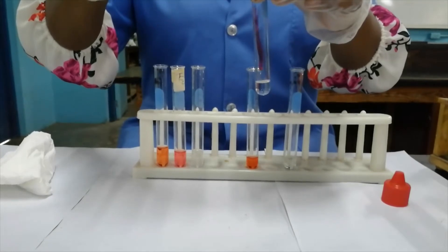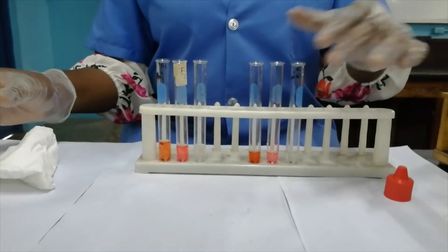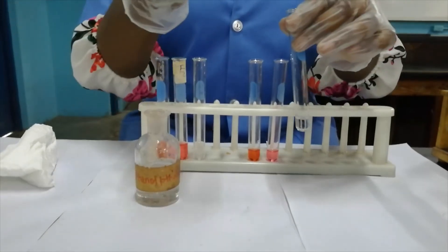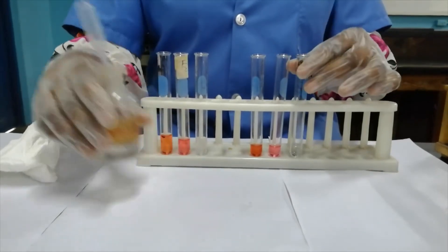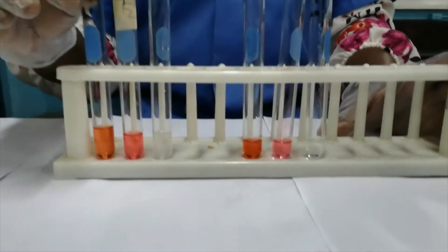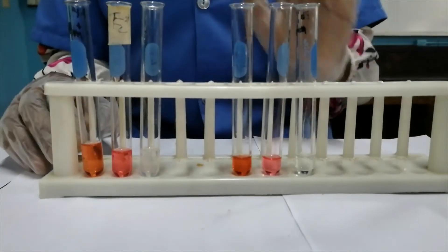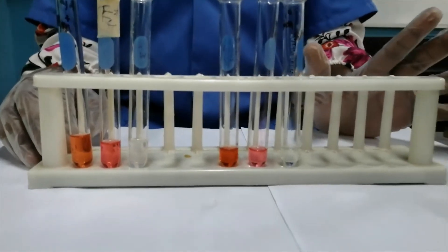That is what indicators are supposed to do — show one color in acids and another color in bases. Phenolphthalein, of course, will be colorless in acids. So this is what the indicators look like in acids: screened methyl orange, methyl orange, and phenolphthalein, demonstrated for both sulfuric acid and nitric acid.